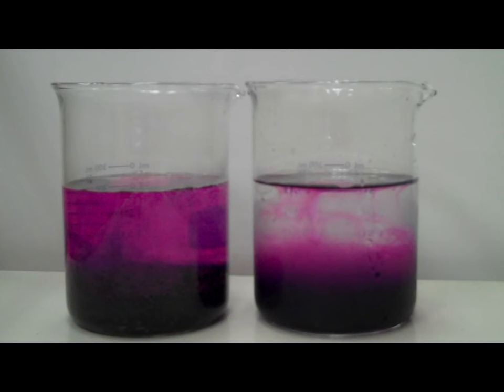Even though the hot water is not as dark as the bottom, the entire cylinder of water, the entire column of water has turned purple. Whereas the cold water, the potassium permanganate has kind of settled to the bottom.